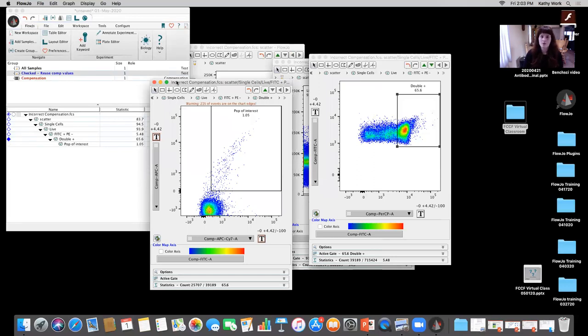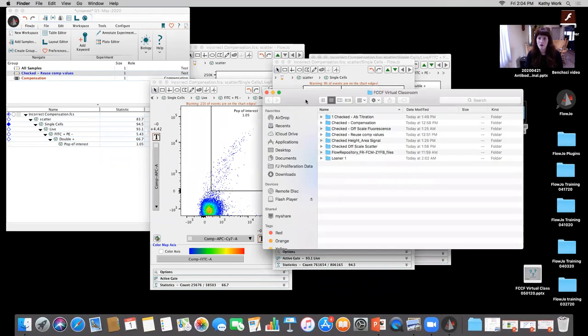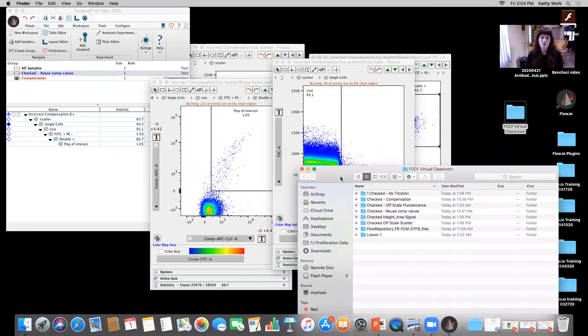This data, to me, whenever you see anything that looks like this that has extreme negatives, I always want you to be mindful and take a look. Now, I went ahead and looked at the appropriate controls, got those single color controls, and took a look at the compensation then. And as opposed to showing compensation and wasting time on how to calculate it in FlowJo, I'm going to show you how to import a matrix.